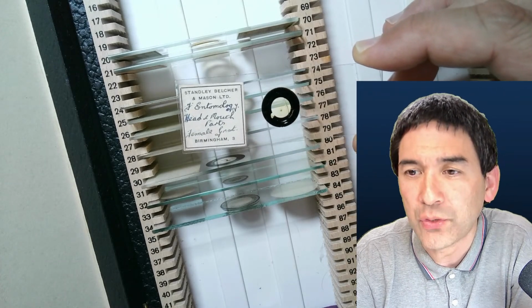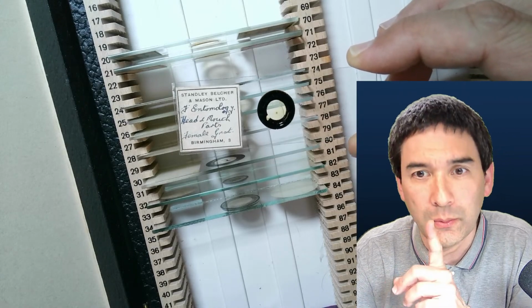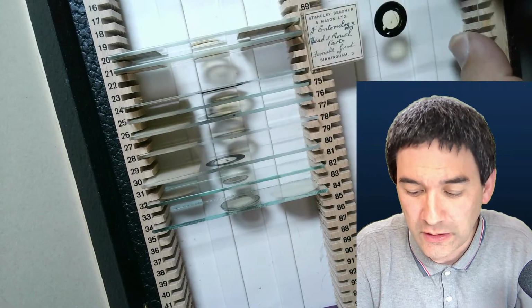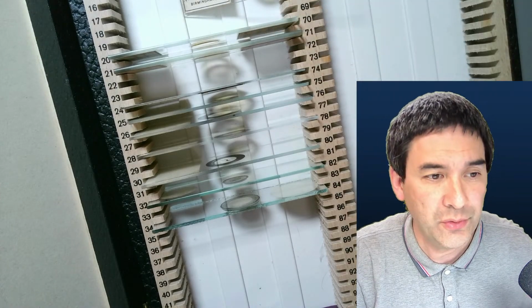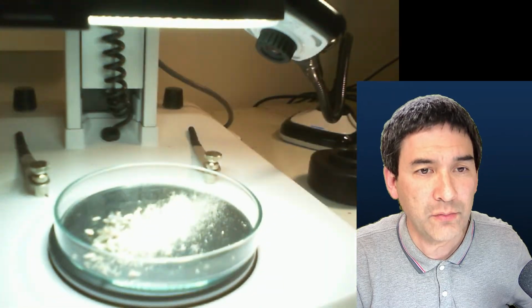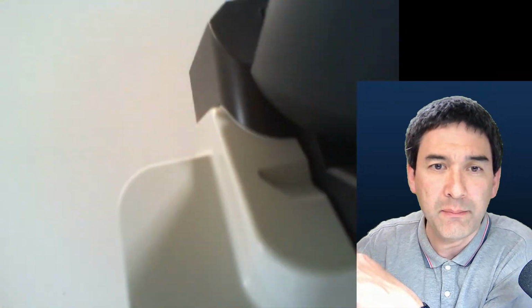Why a new camera setup? Is the image better than your DSLR? Well, that's an interesting one. Just for clarification, I've got 2 microscopes with 2 cameras. Thank you for asking, because this is my stereo microscope. But on the other side I have my compound microscope, which is connected to a DSLR camera, also with HDMI. So I'm able to switch between 2 microscopes.